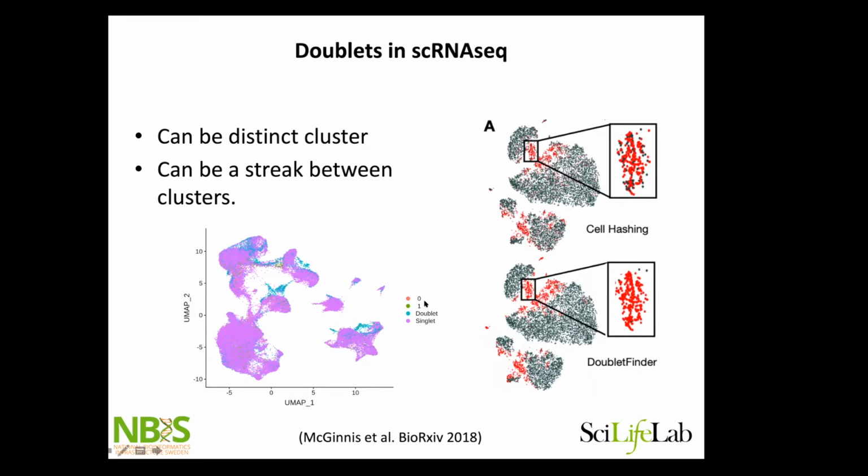What you often see once you do UMAP or t-SNE, if you have these streaks in between clusters, it might on one hand, of course, be a differentiation trajectory, that you have one cell type going to another cell type, but it might also just be doublets. So you have to be really careful with what you believe to be doublets. And also when you do trajectory analysis, not to make any assumptions about differentiation just based on doublets. So it's also a recommendation, I would say, that if your aim with your experiment is trajectory analysis, do not overload when you run 10x, because doublets are much more detrimental in that kind of analysis.